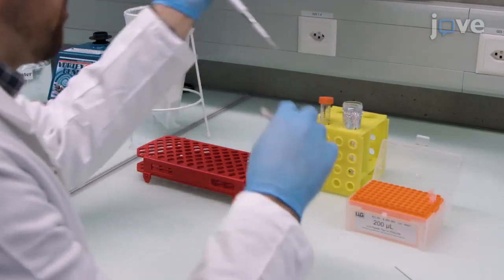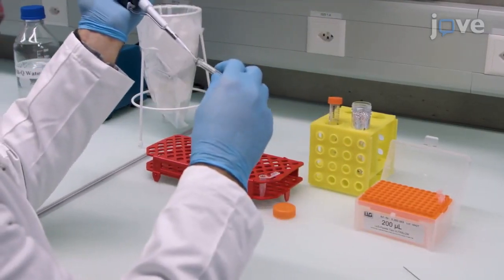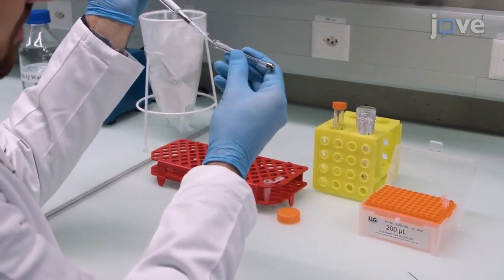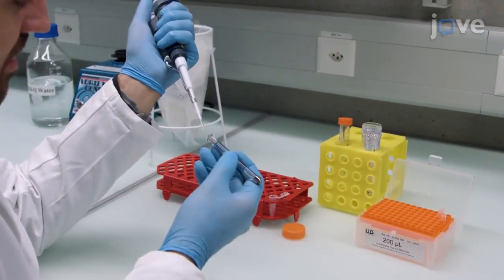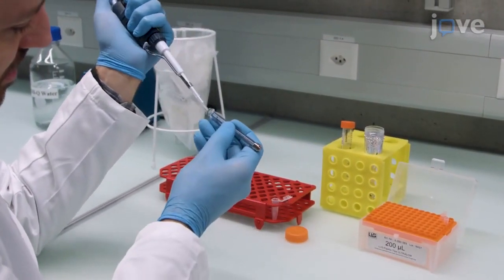For injection into a vacuum environment, load 5 µL of MAG 7.9 and 5 µL of liquid paraffin into the back of a second syringe.